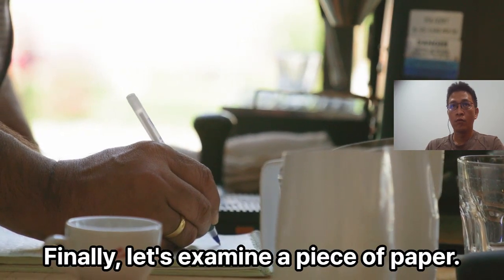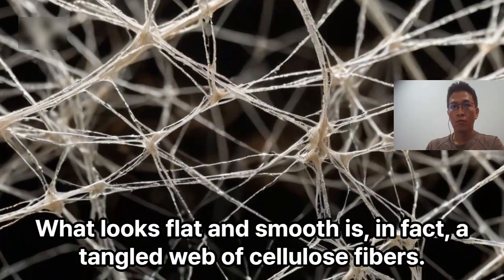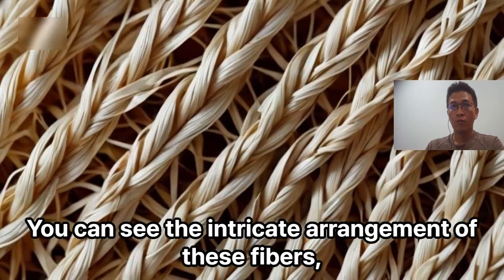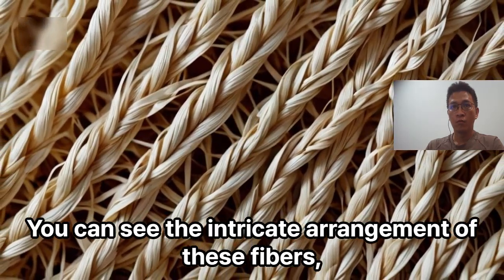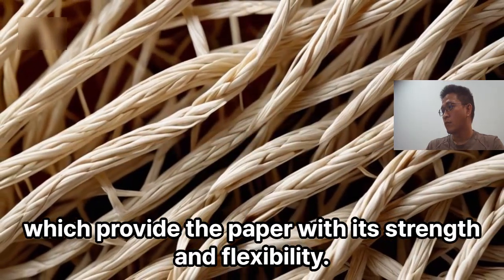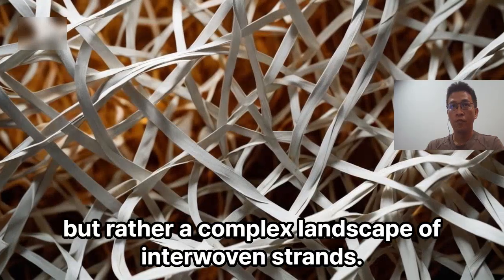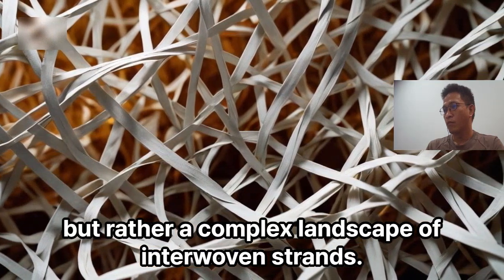Finally, let's examine a piece of paper. What looks flat and smooth is, in fact, a tangled web of cellulose fibers. You can see the intricate arrangement of these fibers, which provide the paper with its strength and flexibility. The surface isn't smooth at all, but rather a complex landscape of interwoven strands.